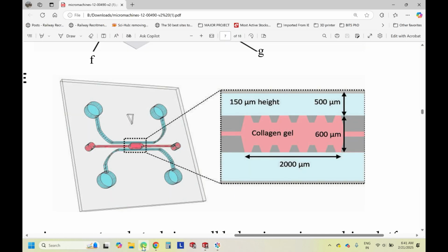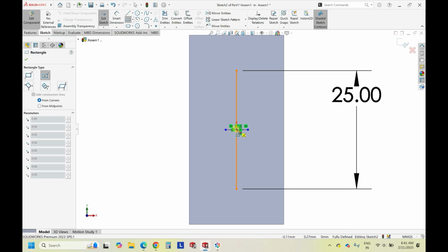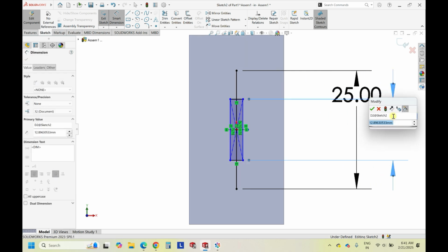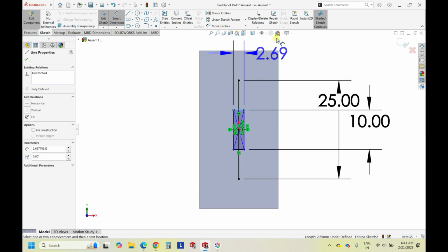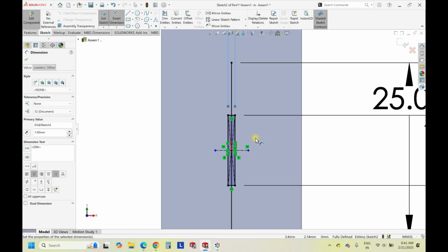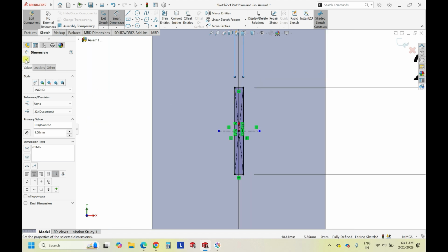And then from this design, if you see, this is basically the region. So there's a microfluidic channel inlet, and this is the region which is like a square. So let's aim to draw a square initially. We can have the square dimensions here. So let's keep it at 10 mm. And this was 600 microns, but I'm keeping it at 1 mm. So it's 1000 microns. These are all arbitrary dimensions, and depending on the applications, you can change them.